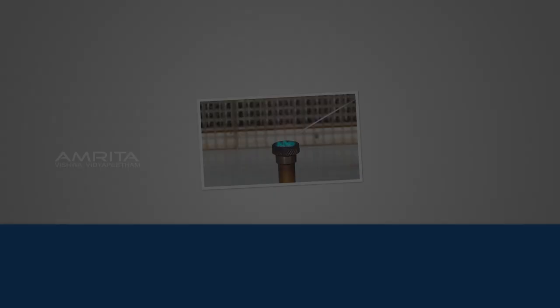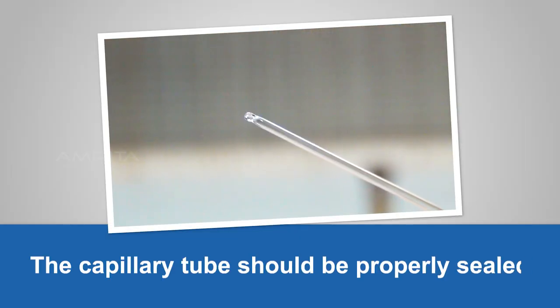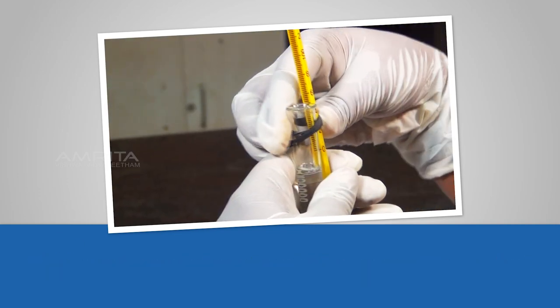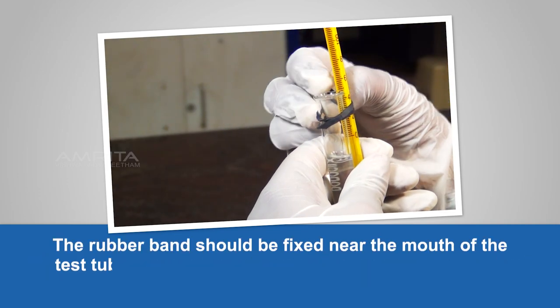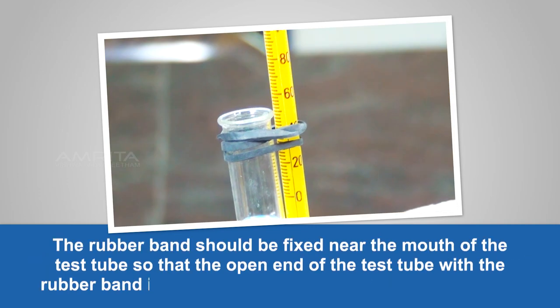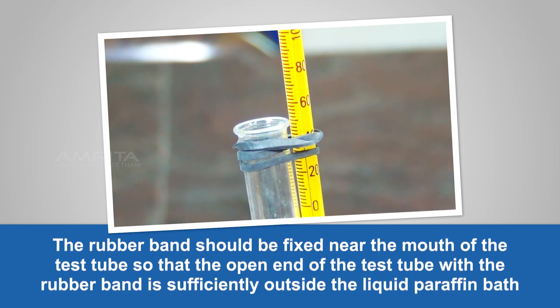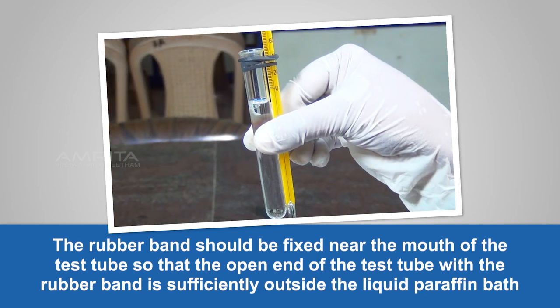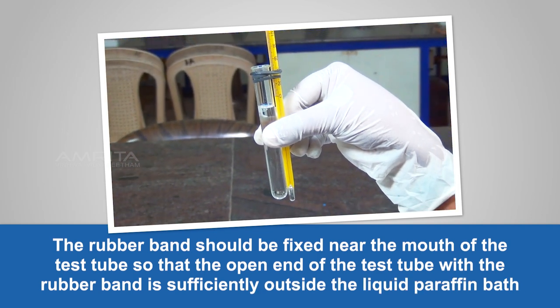Precautions. The capillary tube should be properly sealed. The rubber band should be fixed near the mouth of the test tube so that the open end of the test tube with the rubber band is sufficiently outside the liquid paraffin bath.